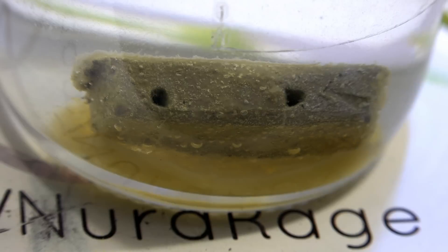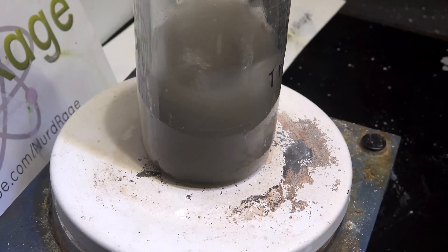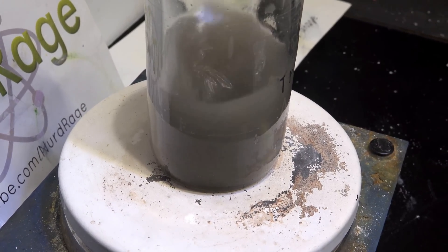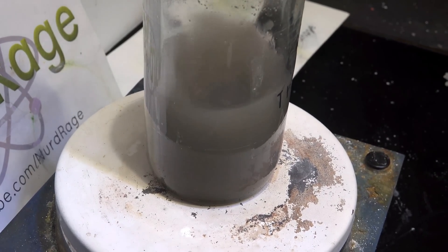This crust of sludge is going to stop further reaction of the sodium, so I'm going to break it up by putting it on stirring. I'm going to leave it here for a few days to ensure complete reaction. I recommend periodically opening the cap and relieving the pressure so the hydrogen buildup doesn't cause the bottle to explode.